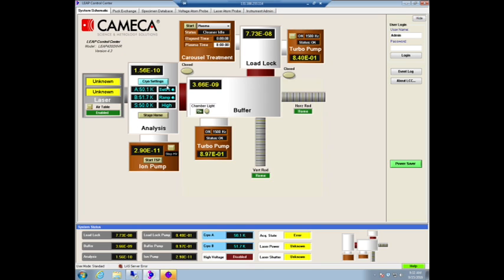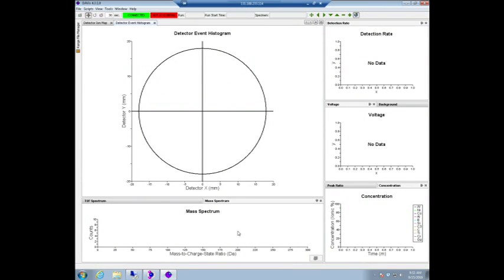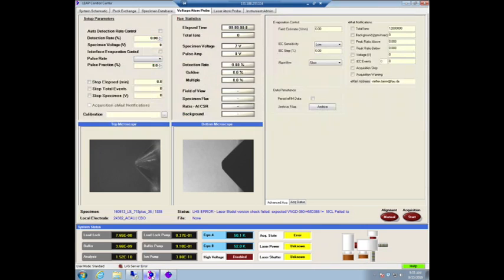We're ready to measure some temperature, so when the temperature goes to an equilibrium. Here we've got the two diodes. It always jumps back to the other program whenever you change tabs. I don't know why it does it, but it only does it in the remote connection, so you don't have to worry about it when you're operating.